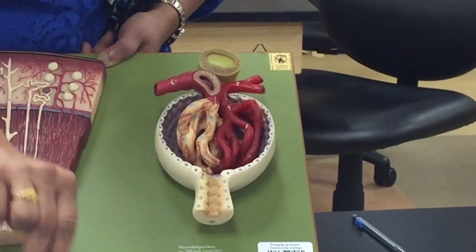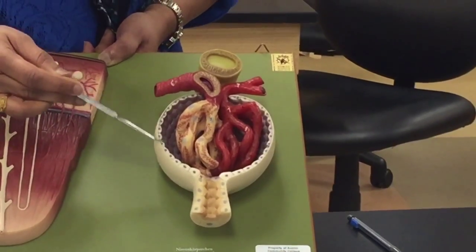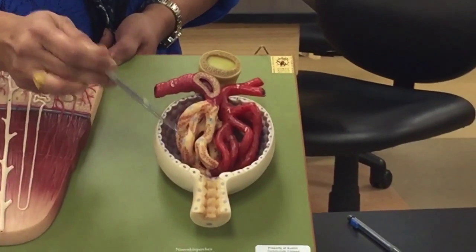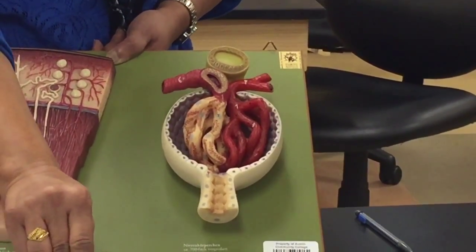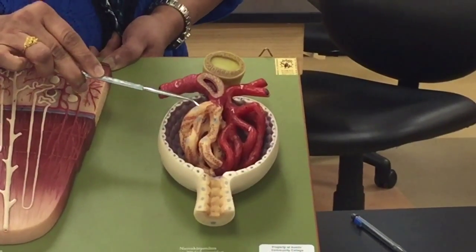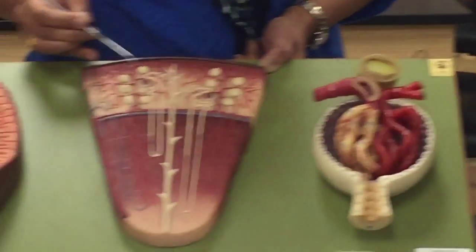So what we've seen here: the renal corpuscle, this whole thing; the glomerular capsule or Bowman's capsule, this cup-shaped structure, the second inner layer of which is on the capillaries; and this is the ball of capillaries, which is the glomerulus; the parietal layer and the visceral layer. Right? Now, that's a magnified view from here.